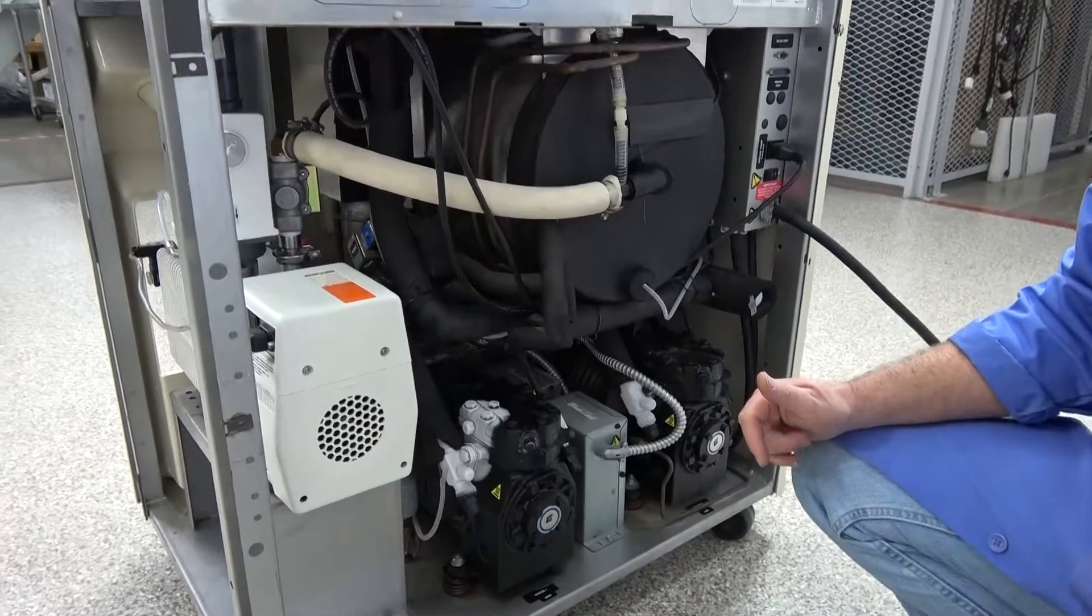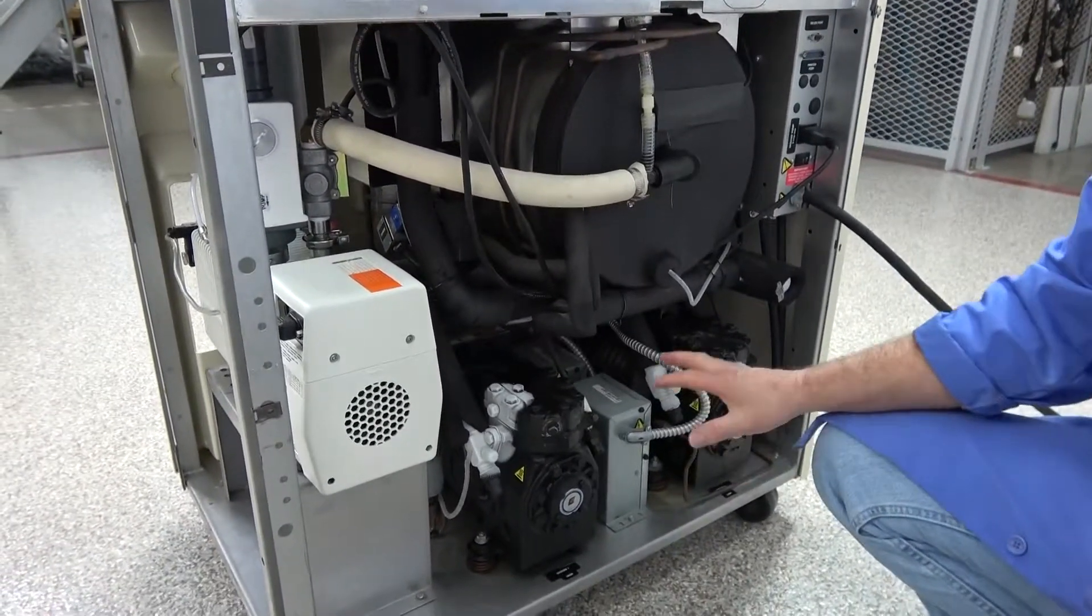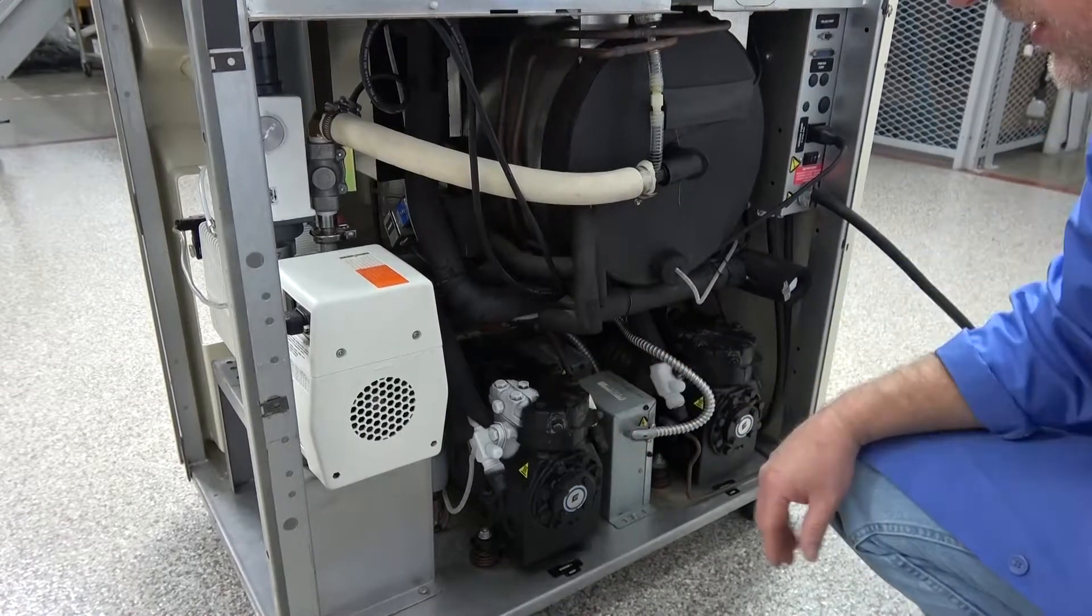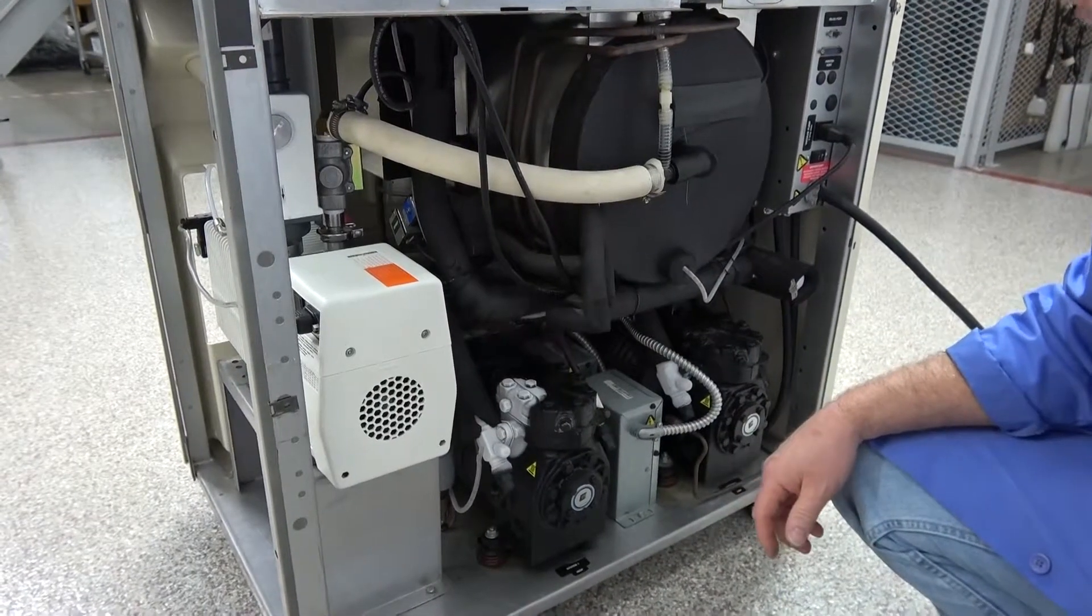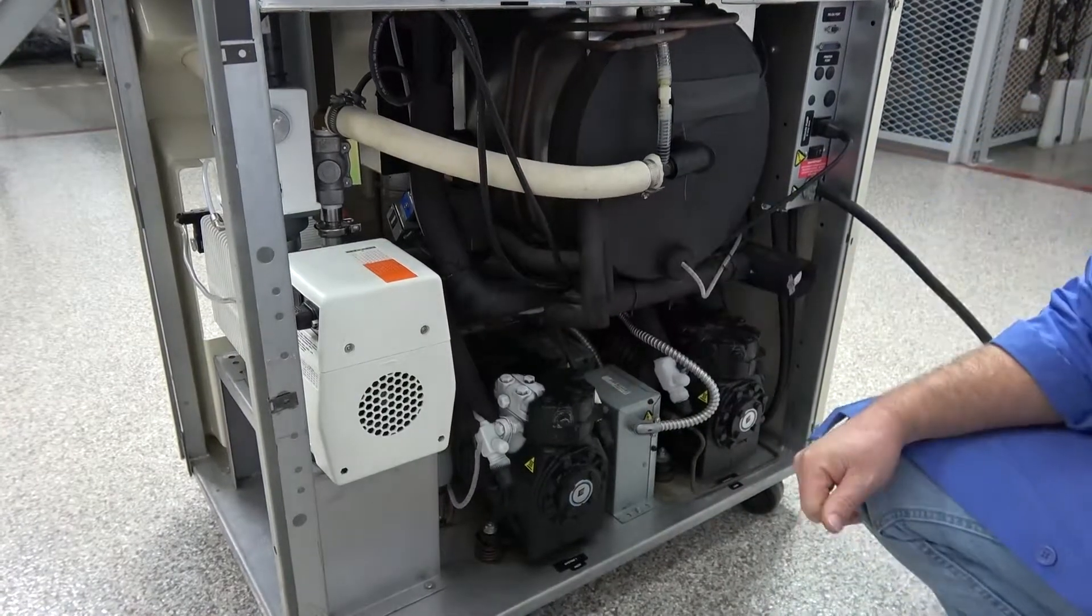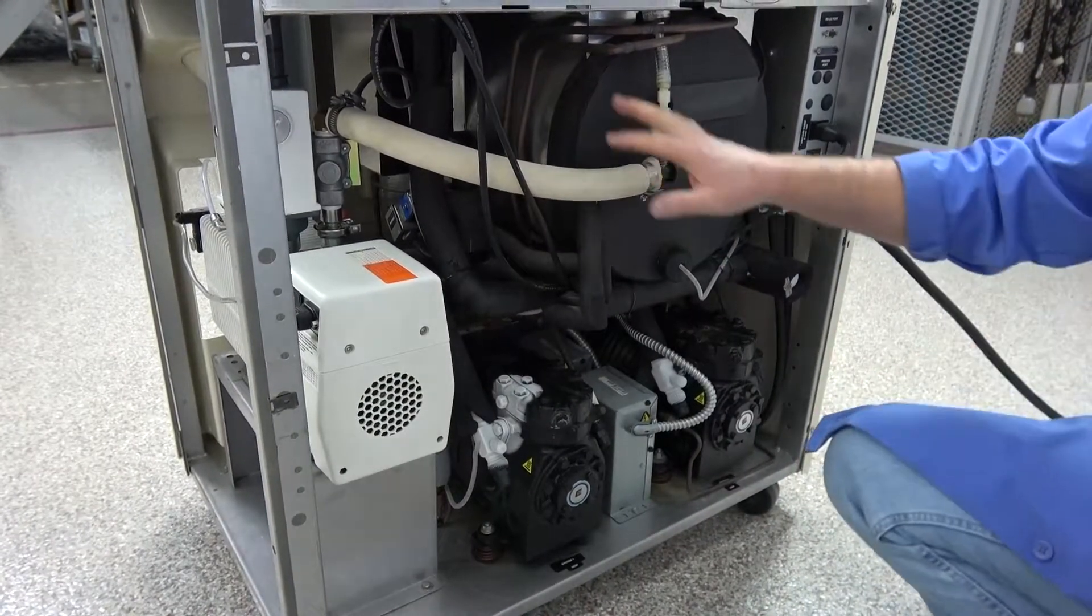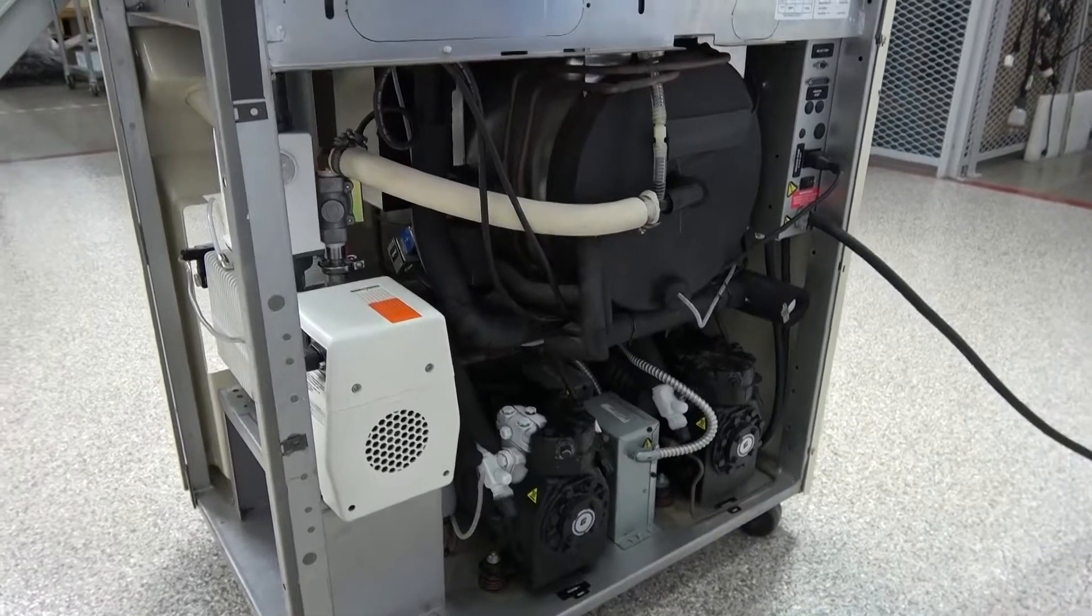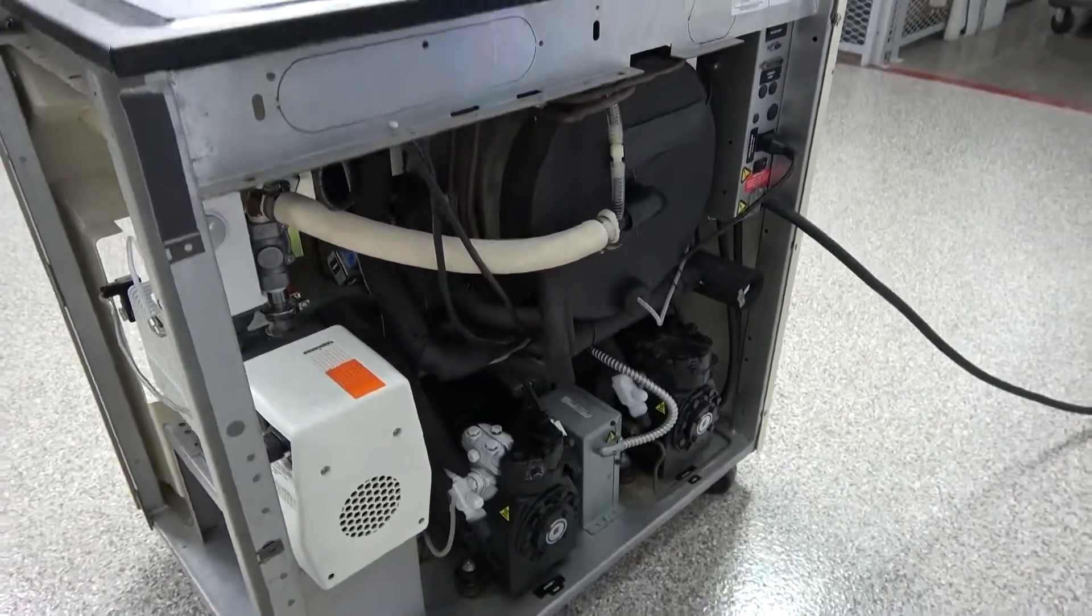Very, like I said, very nice machine. We didn't have to do anything to the compressors at all. They were top-notch when we got them in. The only thing we did is upgraded the vacuum pump with a rebuilt one, replaced the vacuum hose like I said, and thoroughly tested and went through the unit.